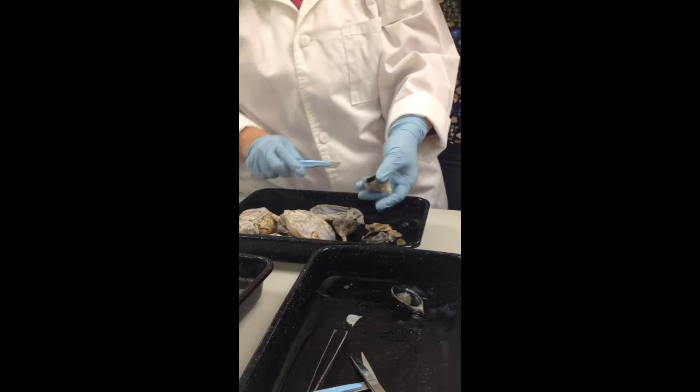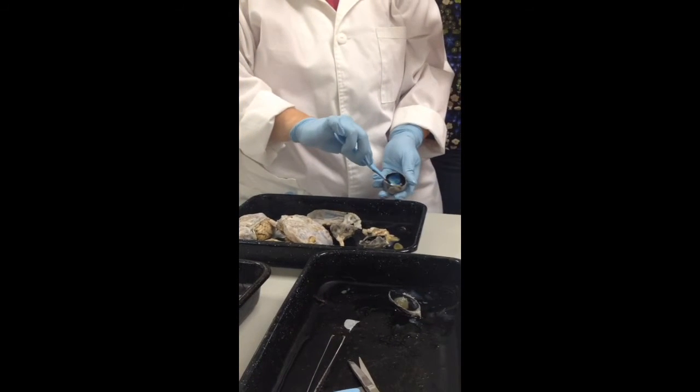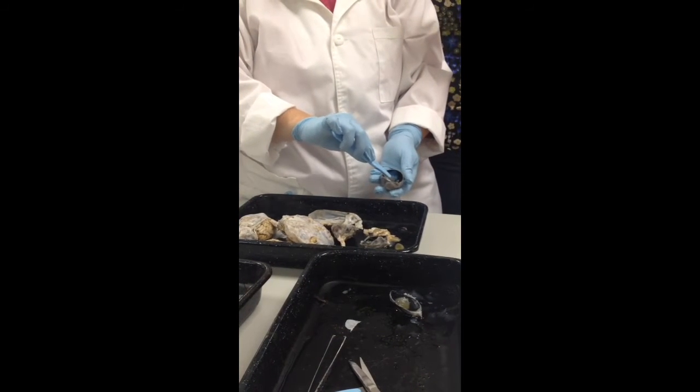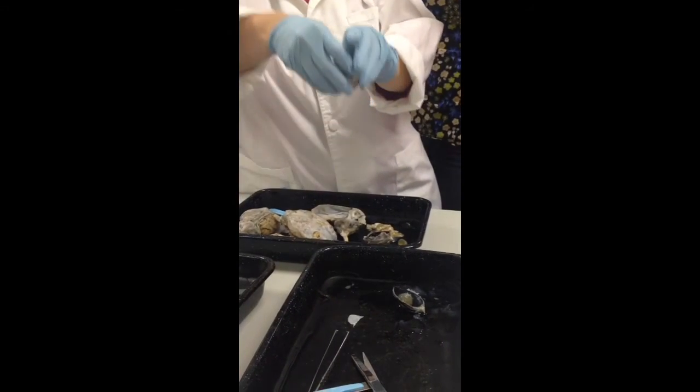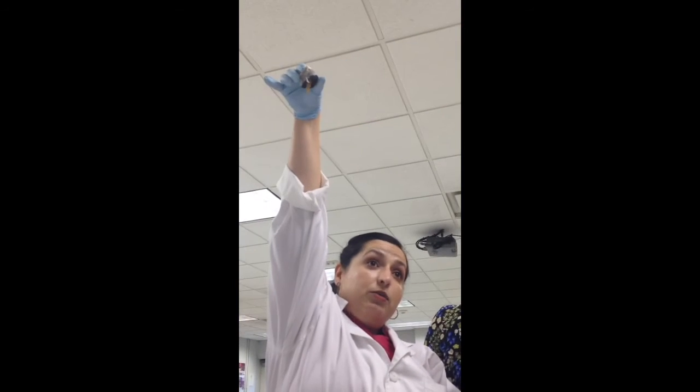And here in this dissection, the retina has collapsed, but it's still attached at the optic disc. And if I were to make this hang like this, notice how it's staying put. All that area where the retina gathers, that is your blind spot.